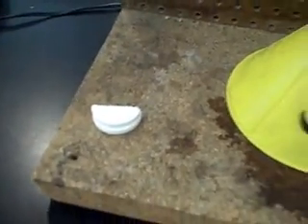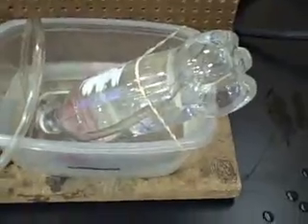And so what we took — Jason and I — we took two Alka-Seltzer tablets, well one, and we split it in half. And we massed this with a test tube with water of 5 milliliters and we got 39.04 grams. The bottle is filled with water as well, 540 milliliters.